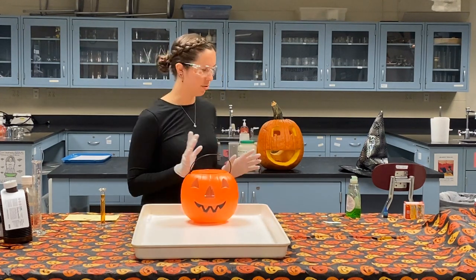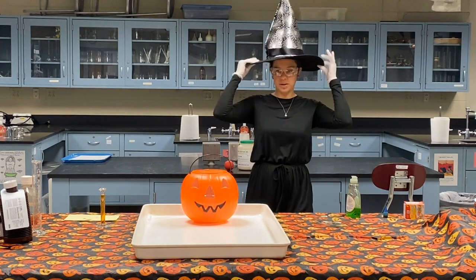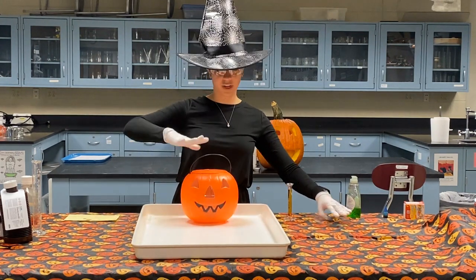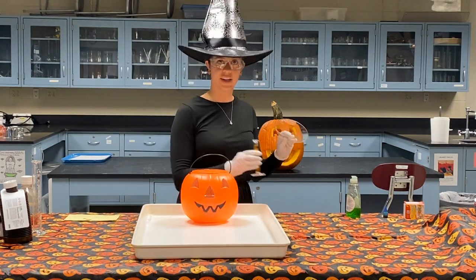All right, so before I add our catalyst, I do need to say the magic words. So I should have the proper attire. All right. Double, double, toil and trouble, fire burn and cauldron bubble. All right, here we go.